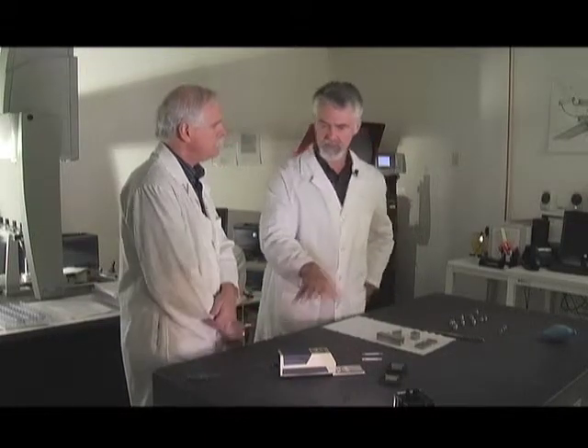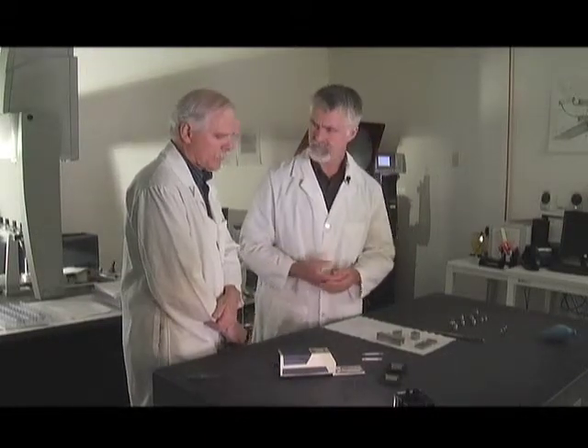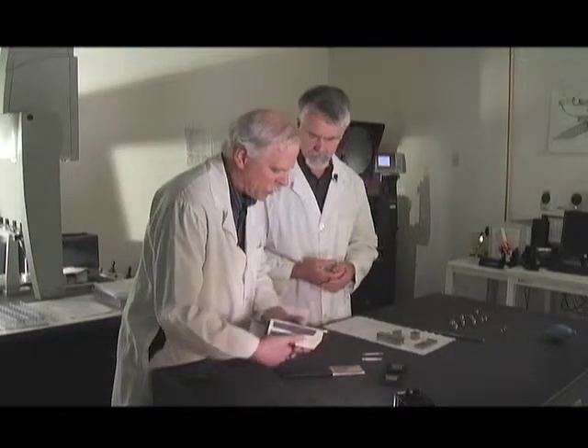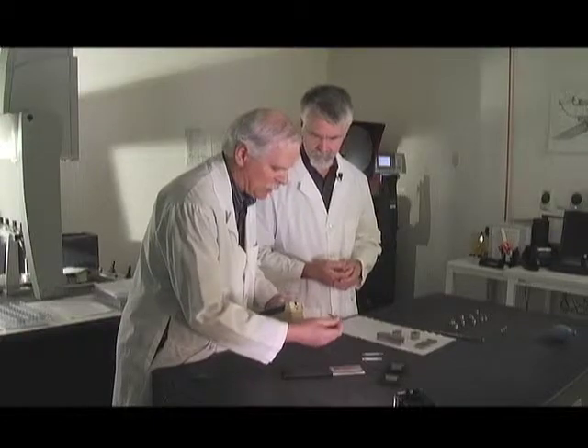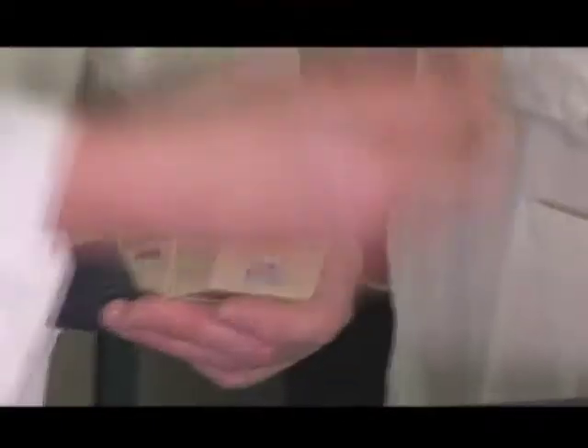As for special considerations in taking care of the equipment: the most fragile part is the stylus, which is the working surface. These probes are replaceable — they do come out. They used to make just replacement styluses that required getting inside and re-soldering, but now you just buy a new probe.